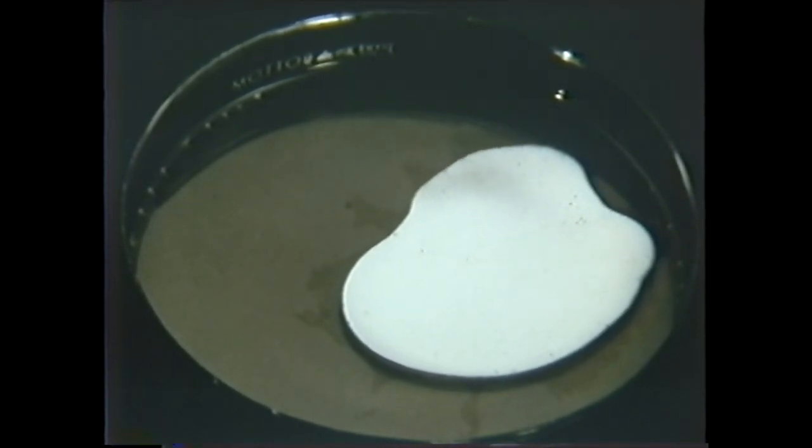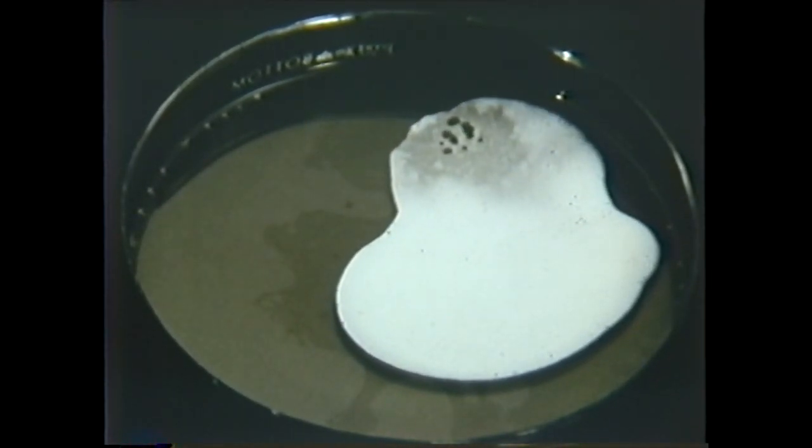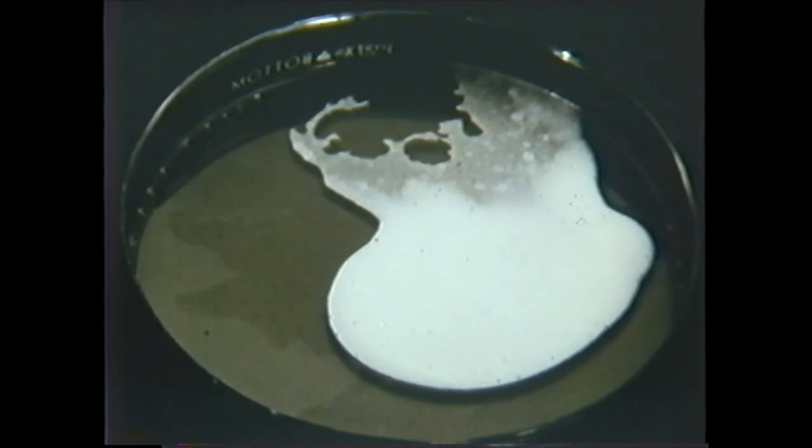To help assist you in seeing the film, a larger amount of concentrate was placed onto the cyclohexane in this rough demo.